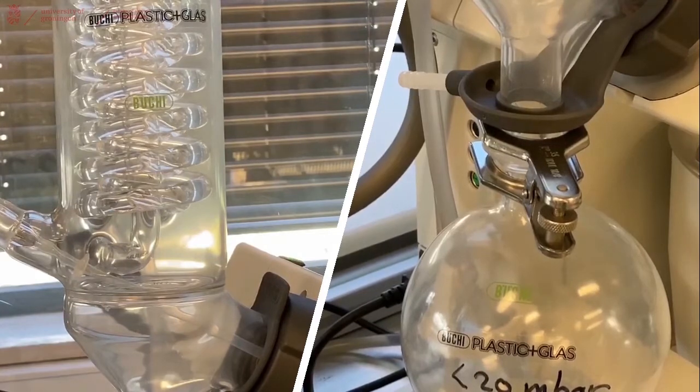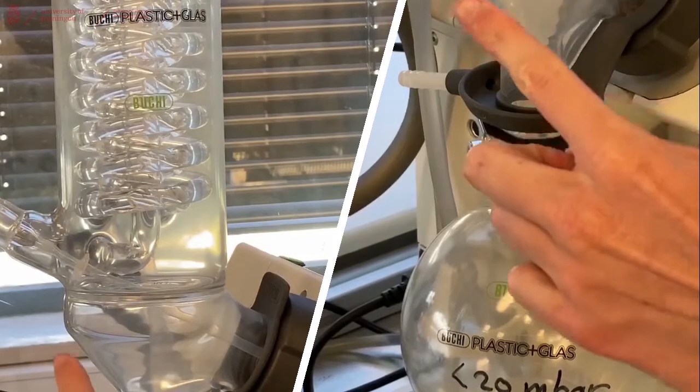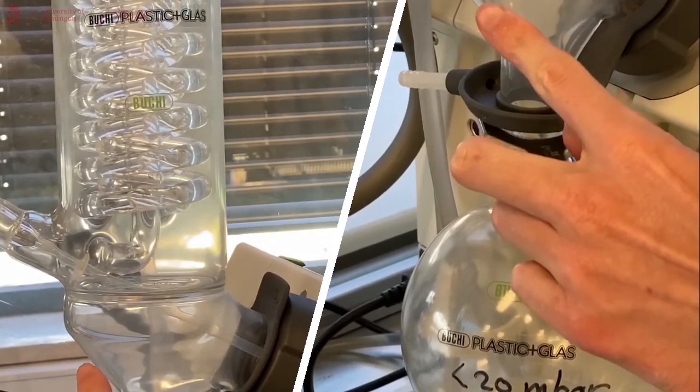Over time, you should see the liquid or the solvent in your flask evaporating. And you should see it condensing in the cooler of the Rotary Evaporator.